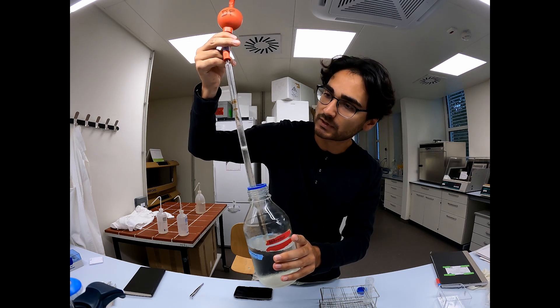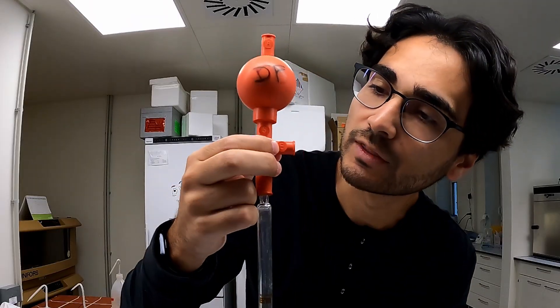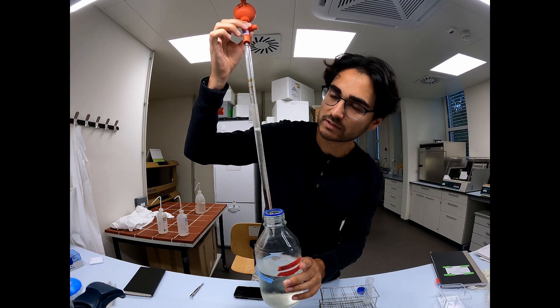And how do you eject? I suck up again with S and I press E on the side to eject. So it's very easy.